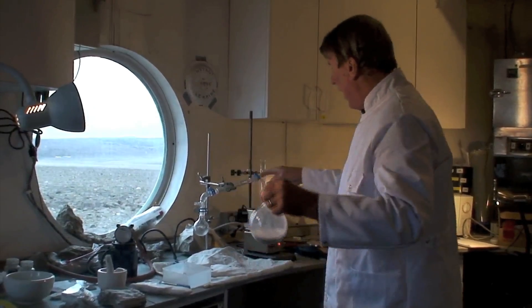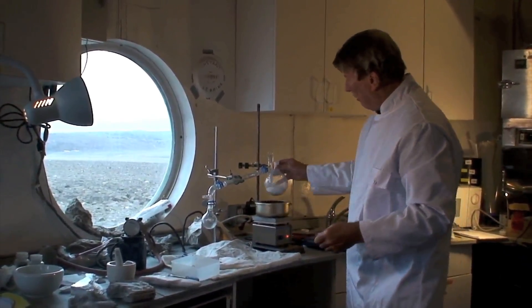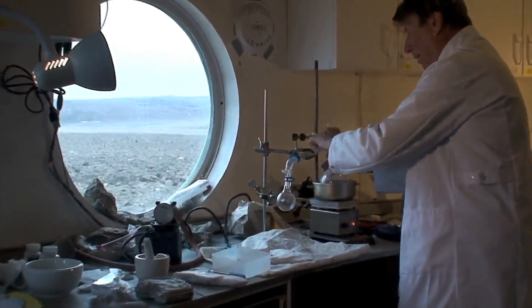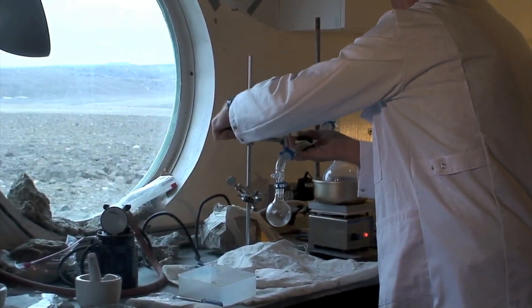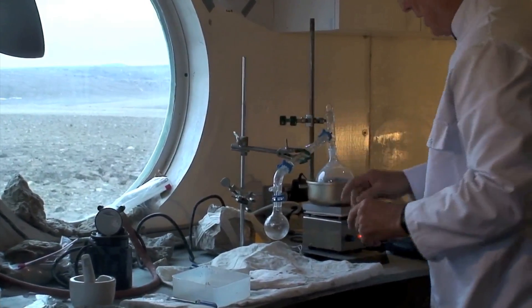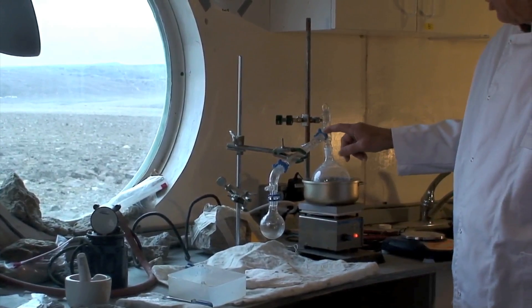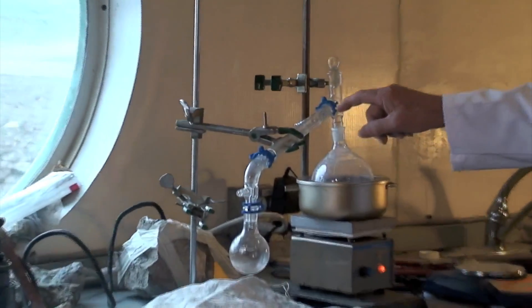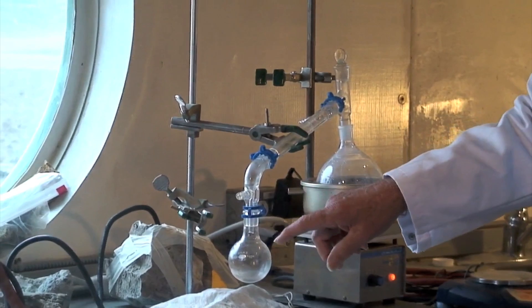I have here a condensation device. I have a heater in which I will put the gypsum, and then I will move this over and put the condensation device on top. Over time, the heat will break the water out of the gypsum, and the water will come along this hollow tube where it will be deposited.